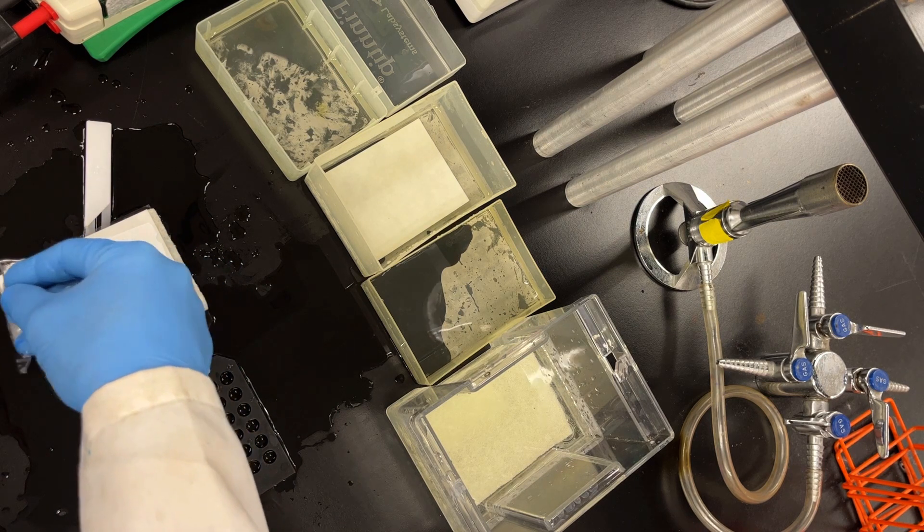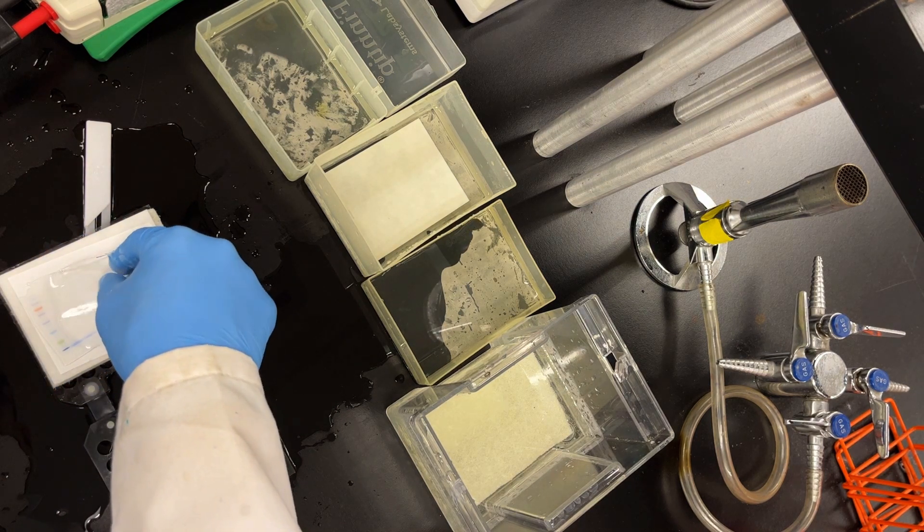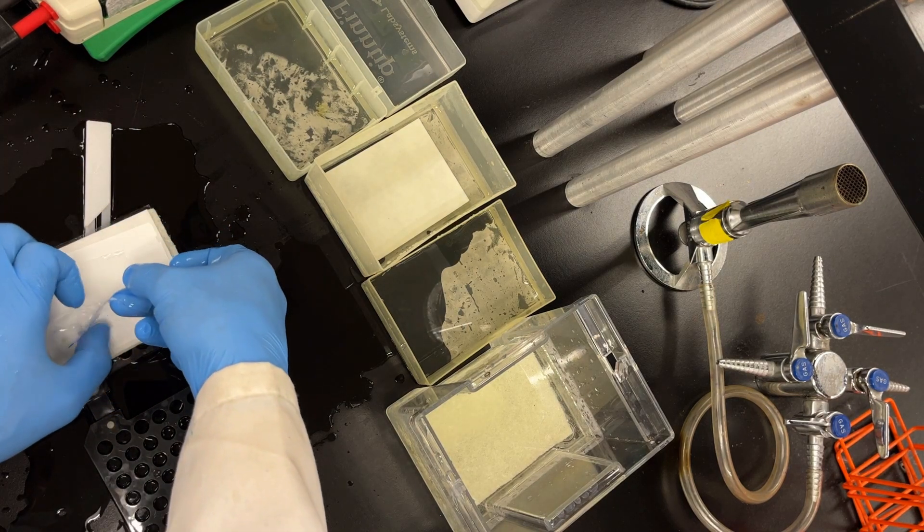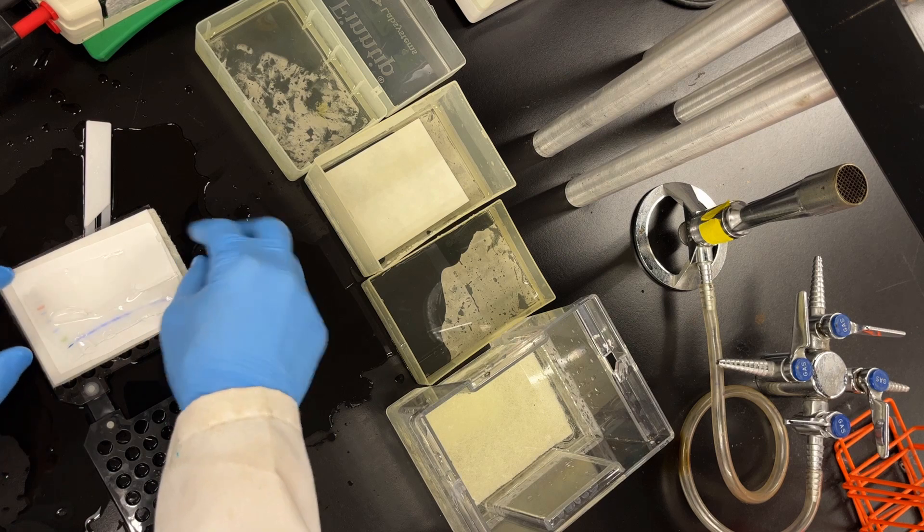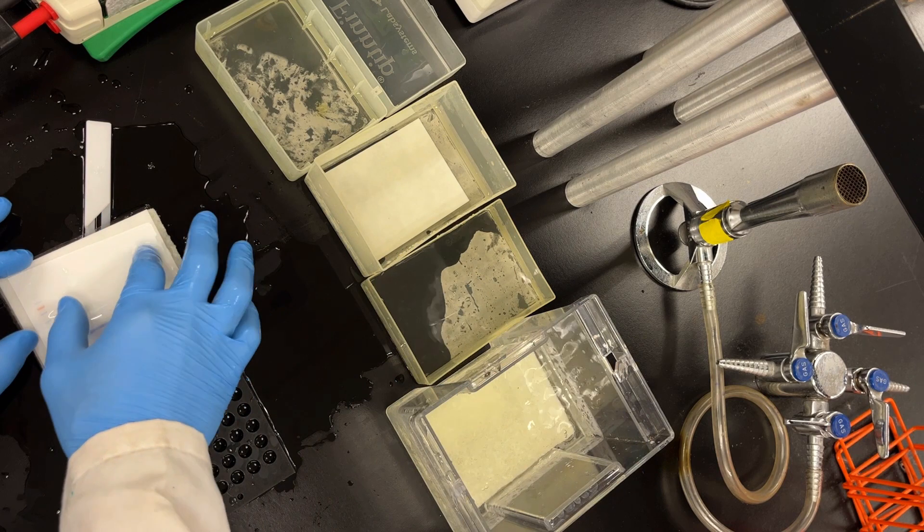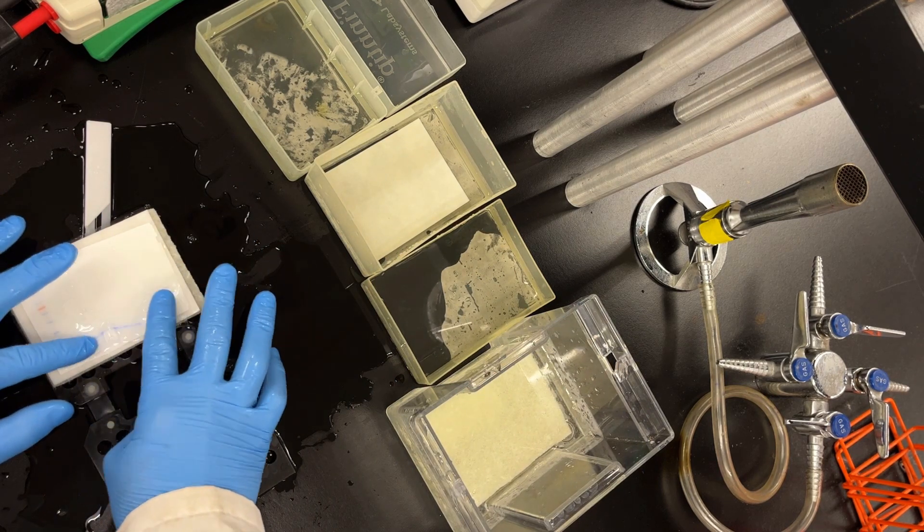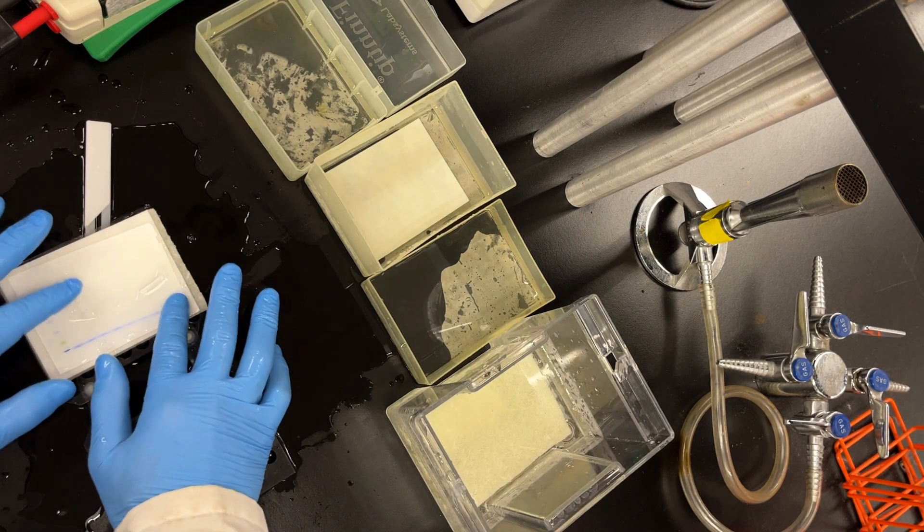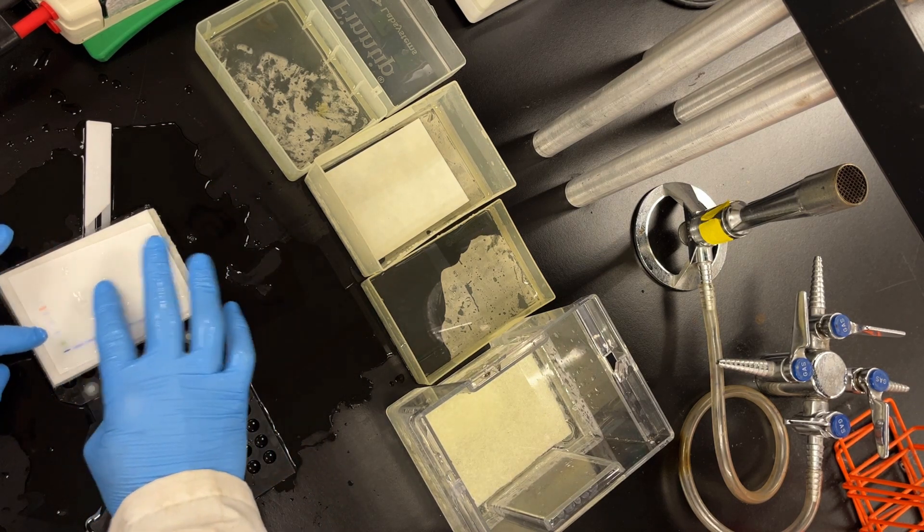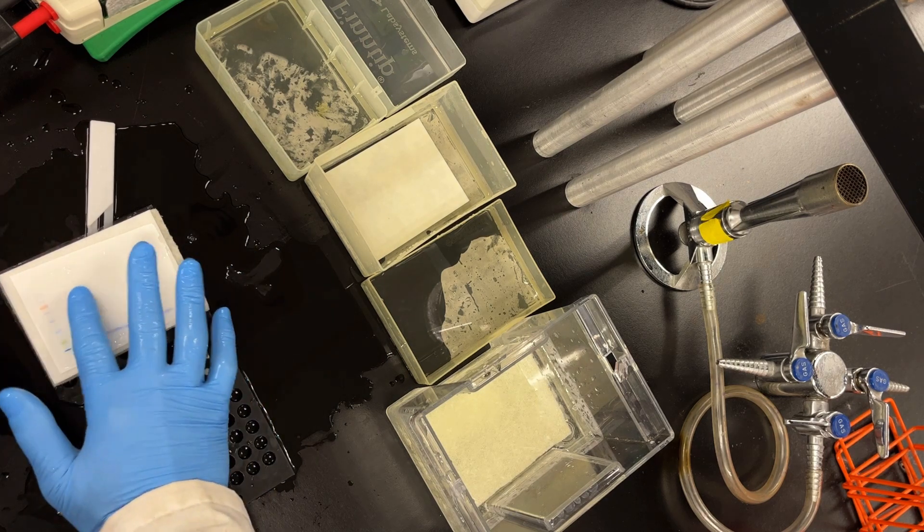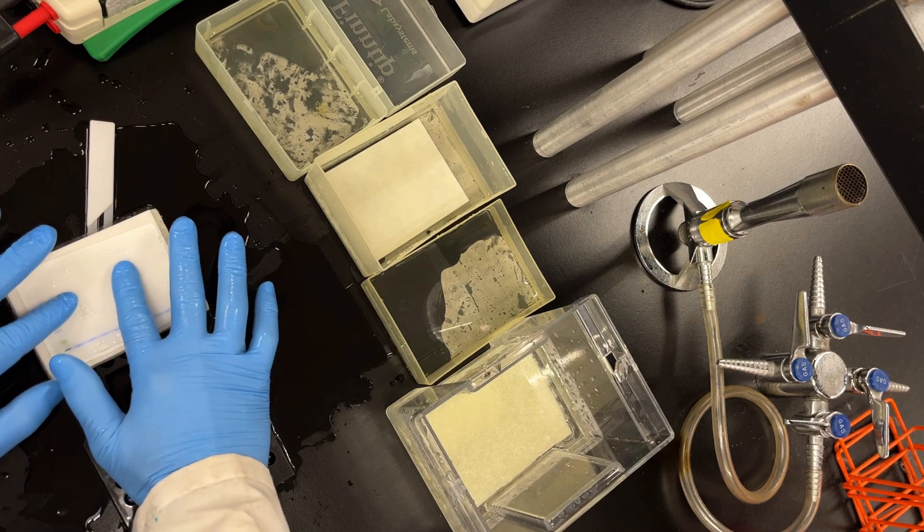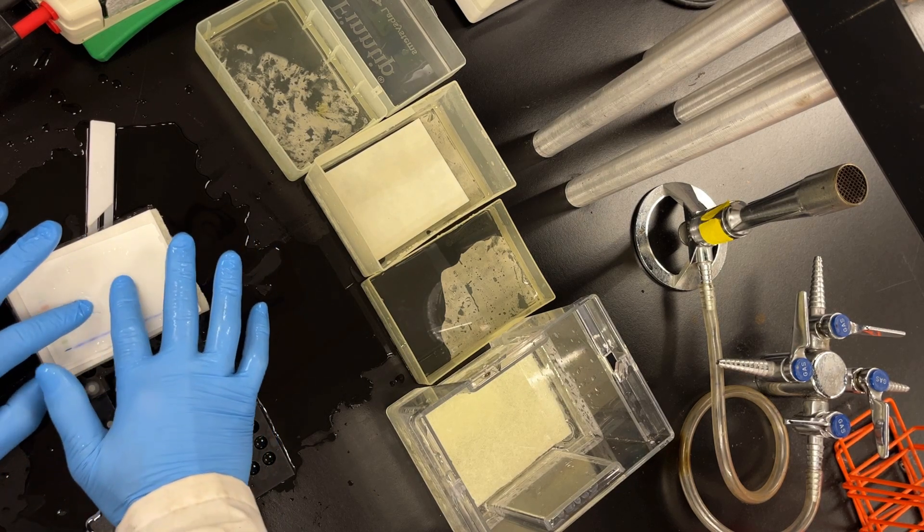Because if I were to build everything on the black side, which is a little bit easier by the way because that little handle that I have to move kind of gets in the way, you have to flip it mirror image or your membrane is going to come out the mirror image. So as long as you know. And then like we'll see later, we're always going to mark the top left. This was my rip gel, which like I said earlier, it's not a huge deal. You can always just kind of piece it together. It's not important that your gel is intact, because you can just put the pieces together. And I've had gels literally rip in half and you just place them together.